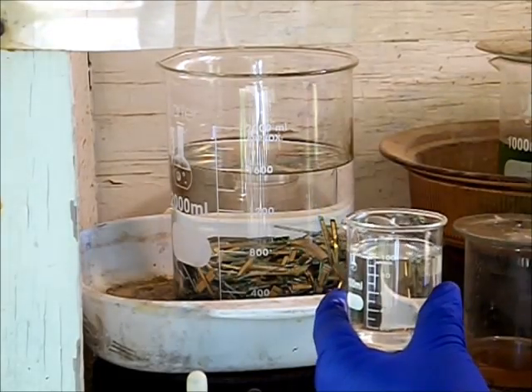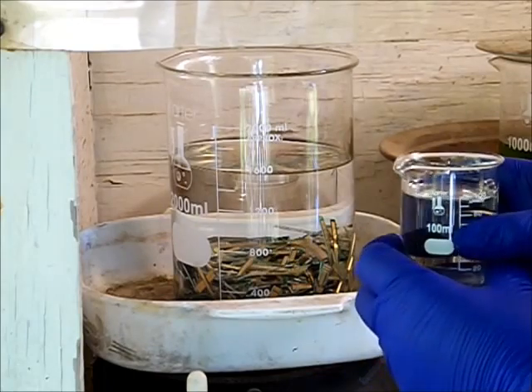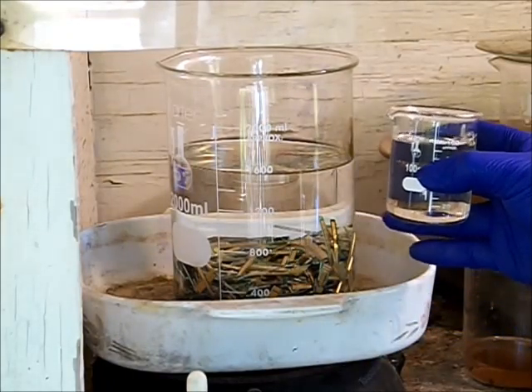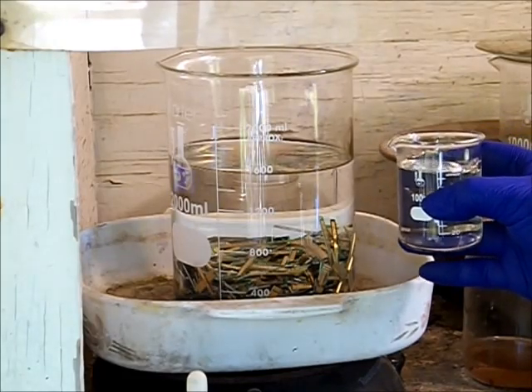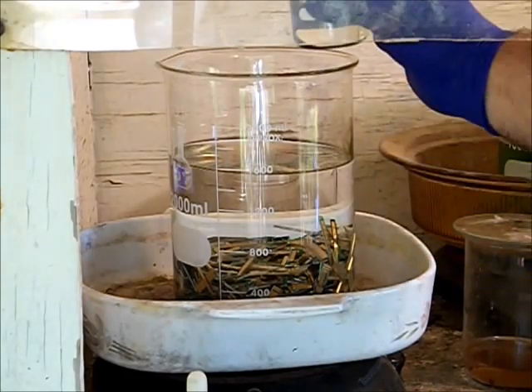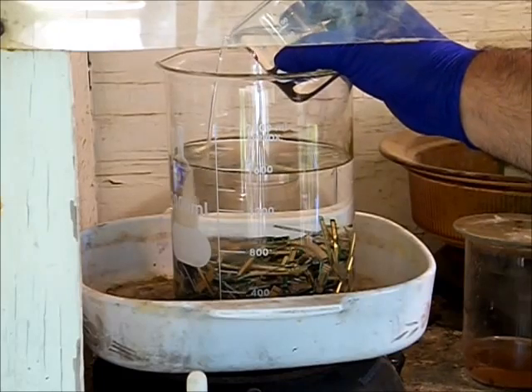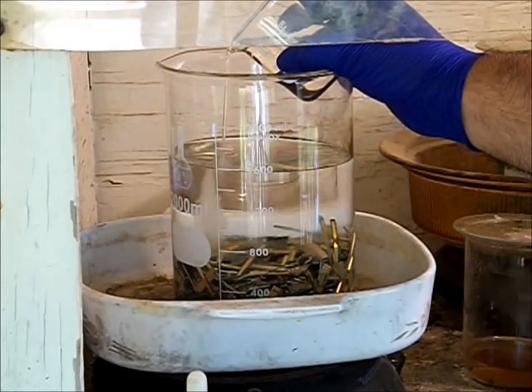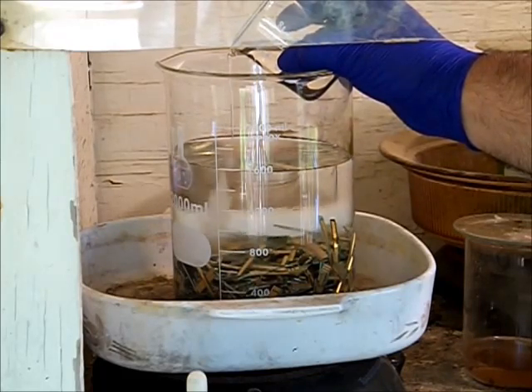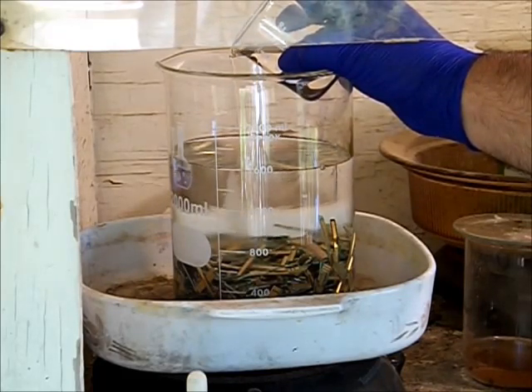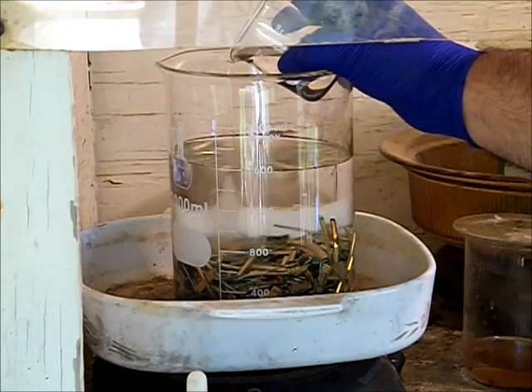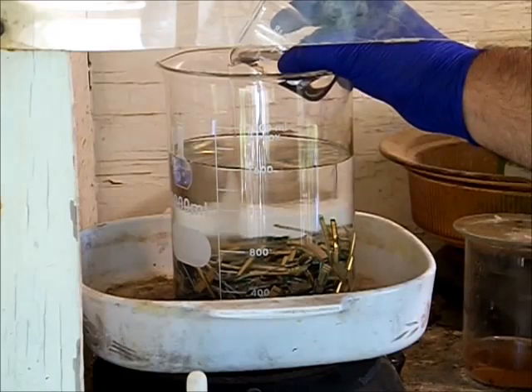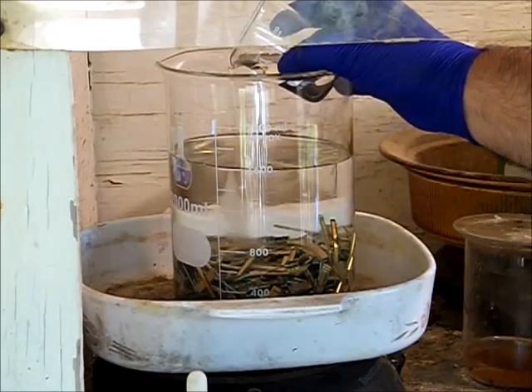You want to add this slowly. With this volume of water it's going to heat up but not drastically. Add slowly and give the water time enough to absorb the acid.